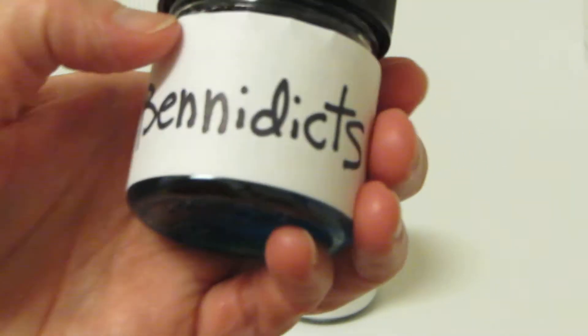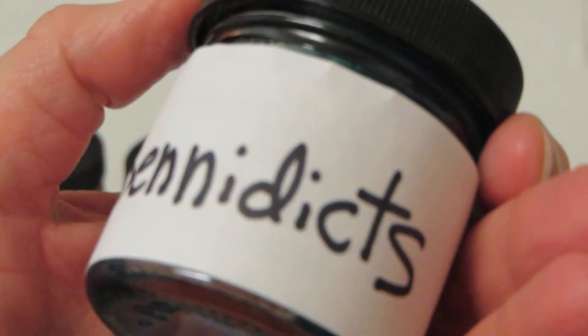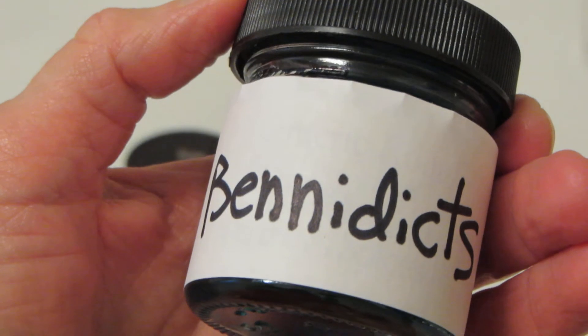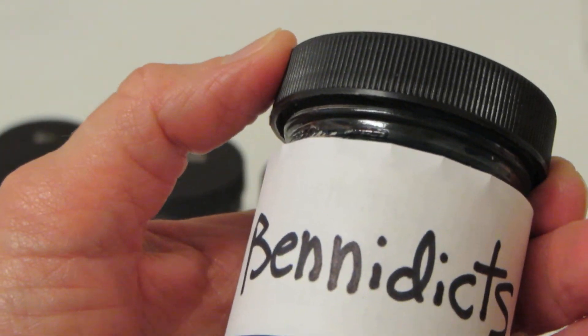Our fourth solution is a brighter blue in color. This one is referred to as Benedict's solution, and it is used to identify simple or reducing sugars.